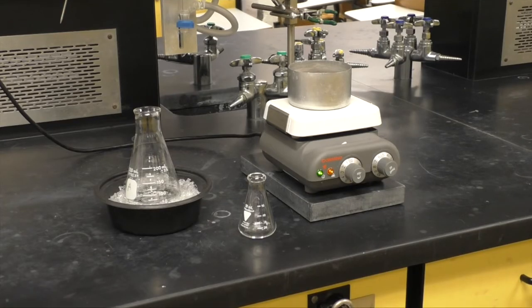Also, set up a hot water bath on a ring stand and bring the water to a boil. You'll also need two clean dry 50 milliliter Erlenmeyer flasks.